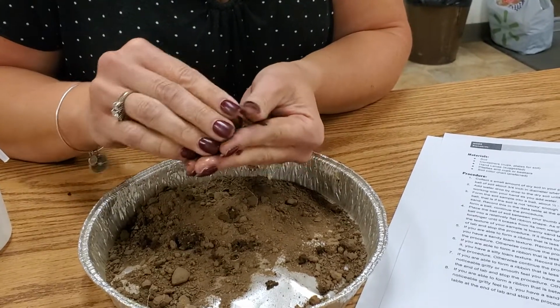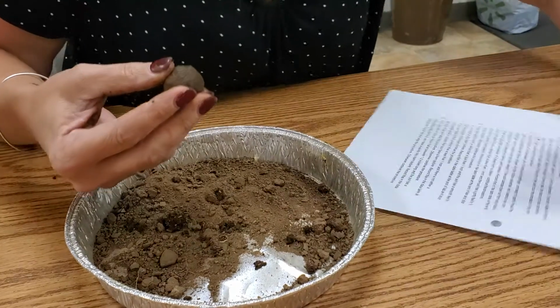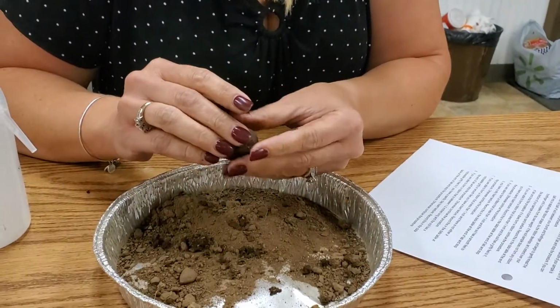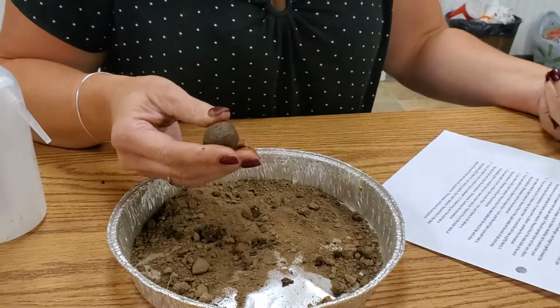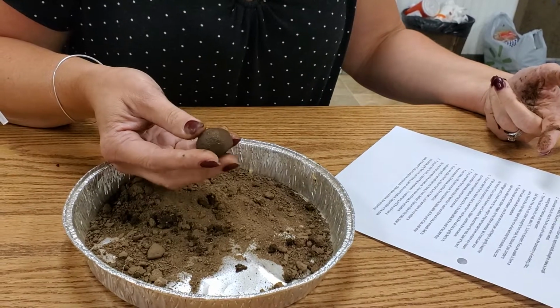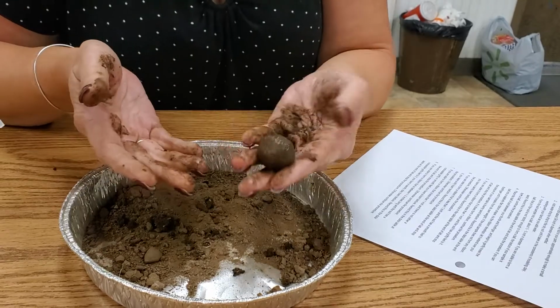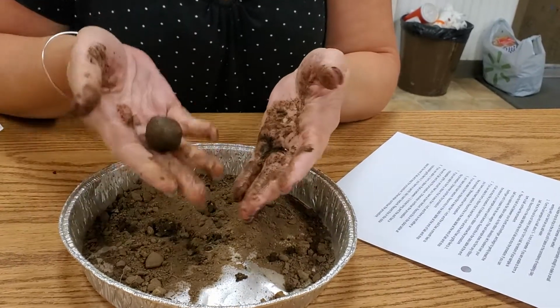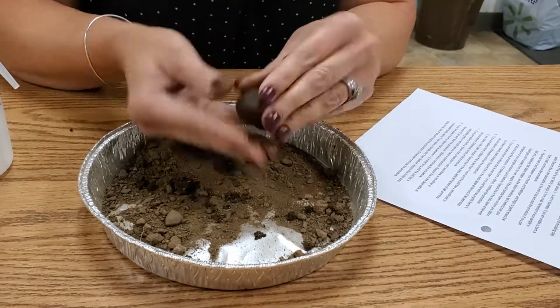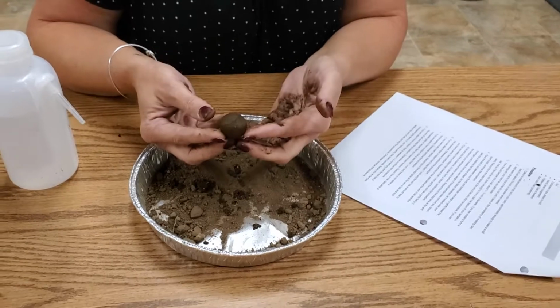If you're unable to form it into a ball, then, I've got to turn this sideways, sorry. I've got to go back and read this. So, form the soil sample into a ball. If you're unable to form a ball, that is, if the soil is not sticky enough to form a ball, the texture of your sample is sand. Well, mine is actually able to form a ball and stay in a ball. If I throw it, it doesn't break. If it was sand, and I put it in a ball that I tried to hold together and throw it, the second I tossed it, it would break into pieces. So this is definitely not completely sand.